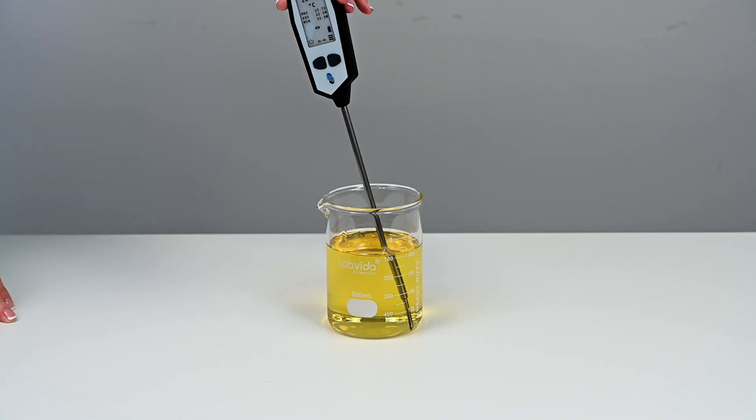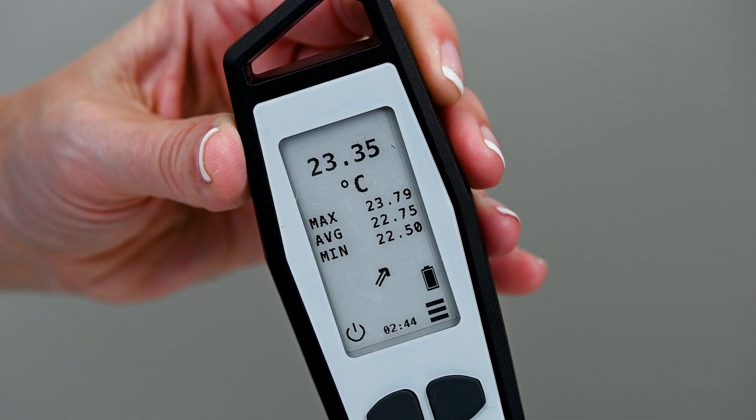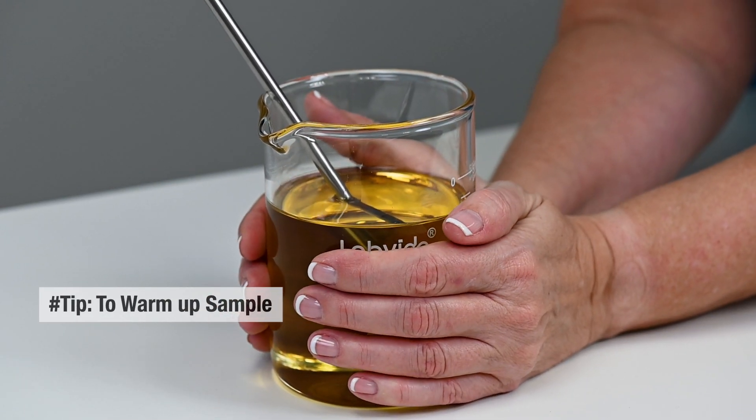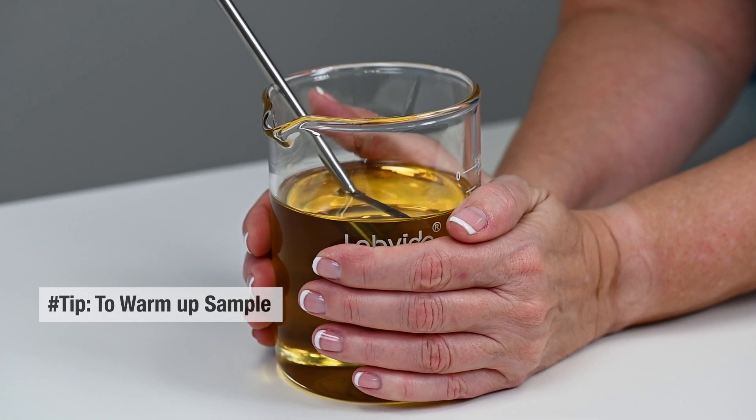Stir the sample making sure it is free of bubbles. Measure and record the temperature. To warm up the sample if necessary, place both hands around the sample.